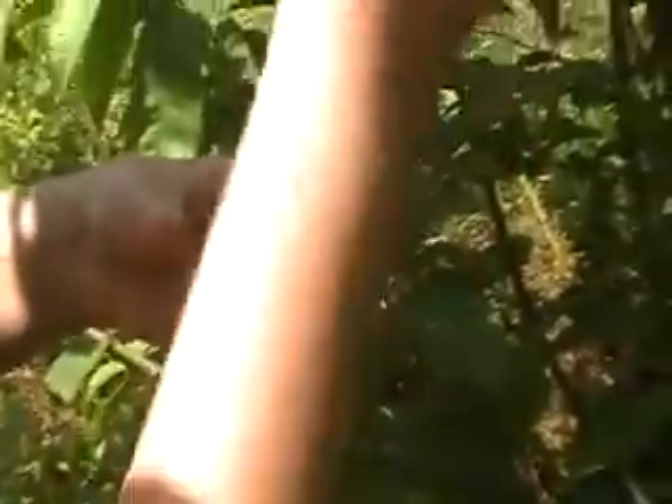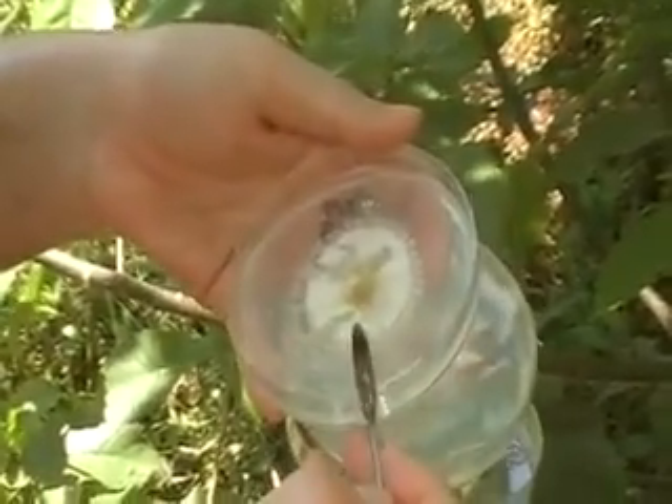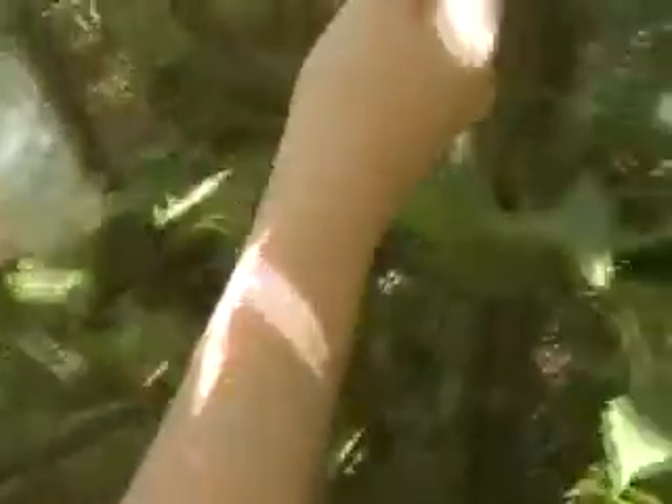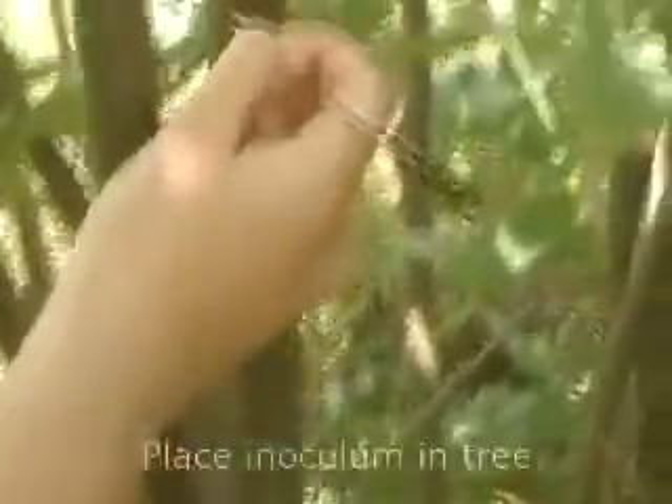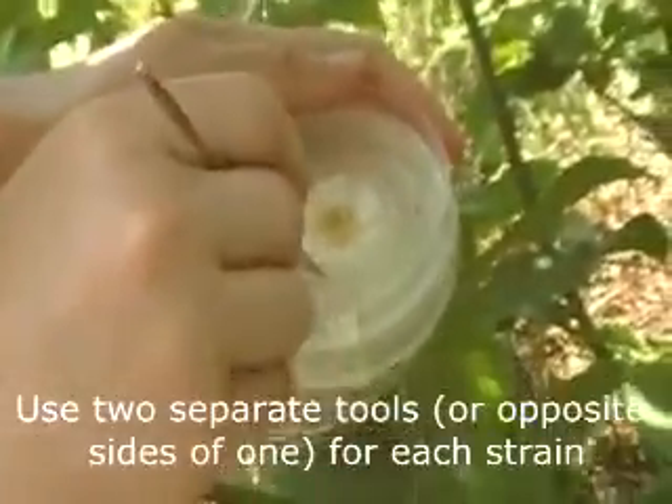You want to pull out a piece of bark for each spot. I'm about to put the inoculum in the tree — the SG on top. Make sure that's SG. You want to put the fuzzy side in the tree first. And the bottom is the 155, which is more virulent.